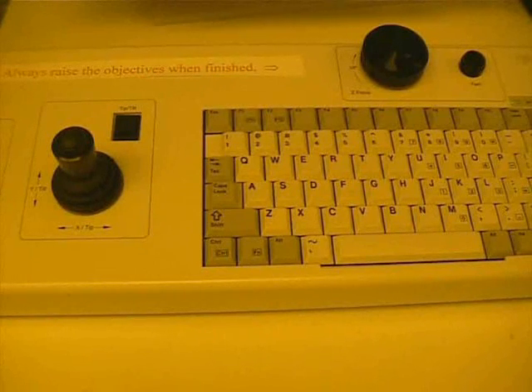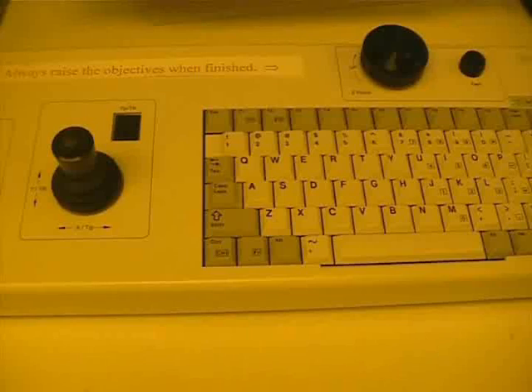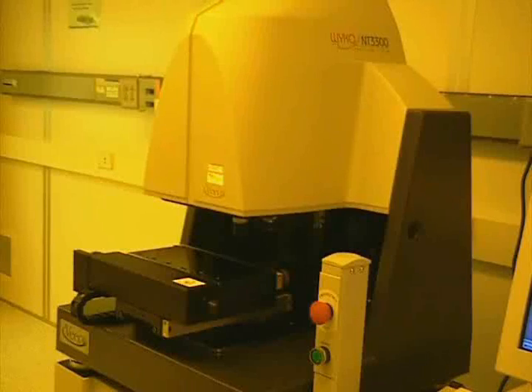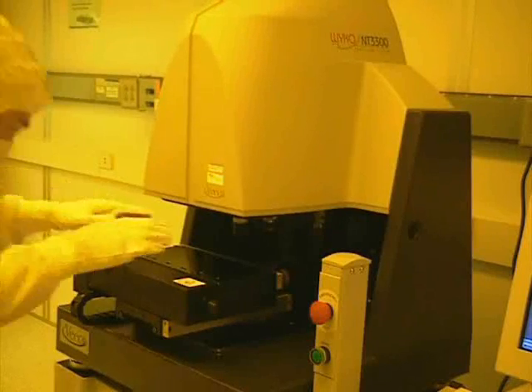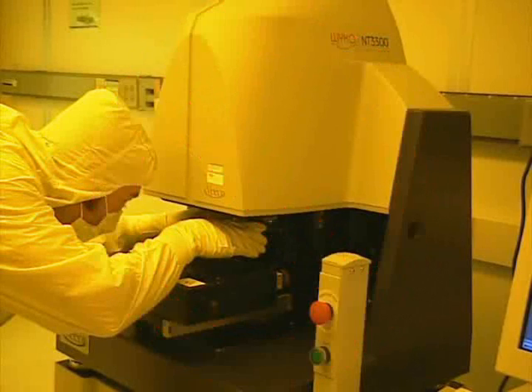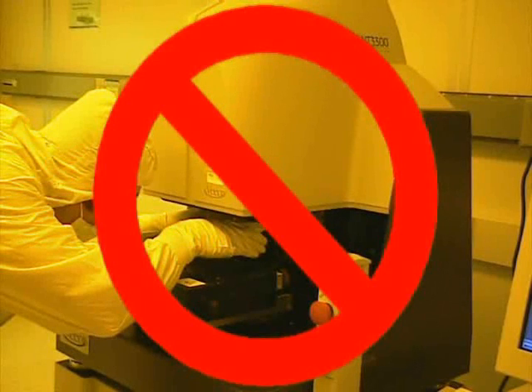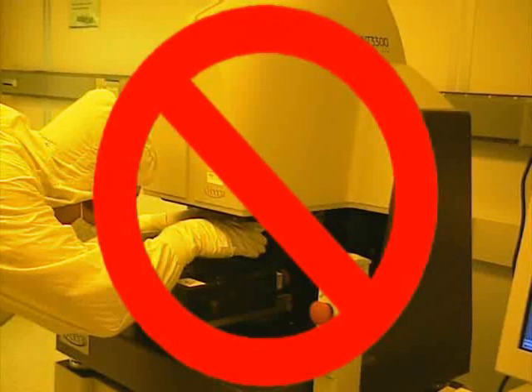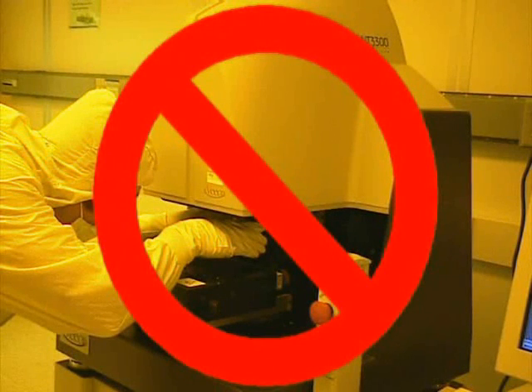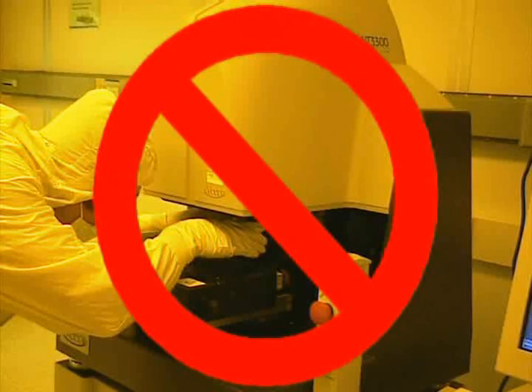This can be seen by the reflection on a white piece of paper. Once the software has started, we can now operate the profilometer with the keyboard. You do not ever need to touch the profilometer. Everything can be operated from the keyboard.